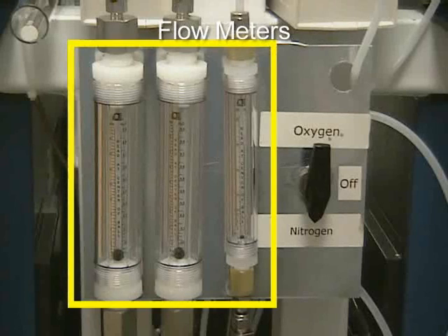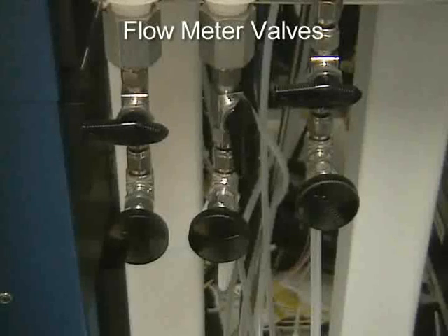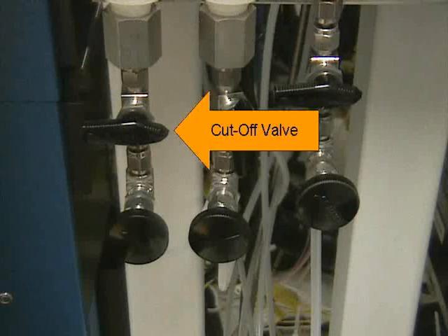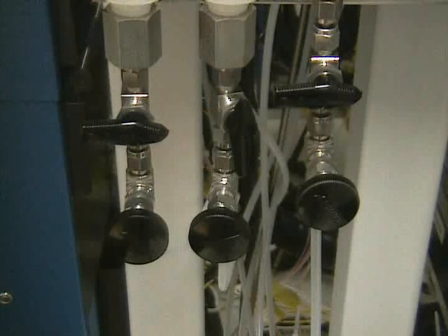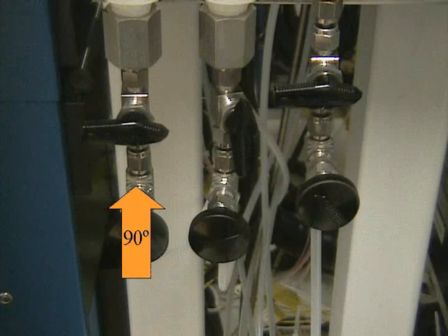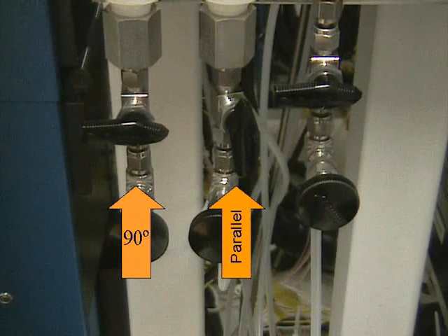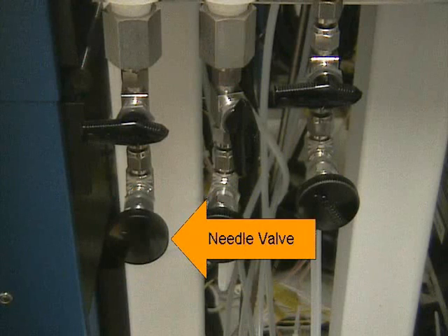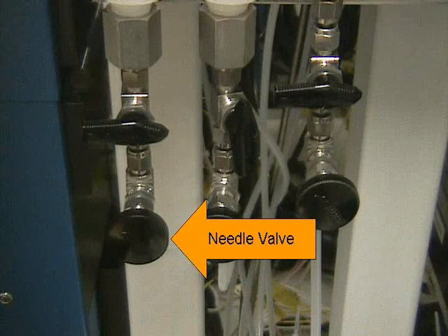There are three flow meters located just below the gas flow timers. Beneath each of the flow meters are two flow meter valves. The cutoff valves are closest to the flow meters — handles at a 90-degree angle from the flow meters are closed; when the handles are parallel with the flow meters, they are open. The lower valves are the needle valves, which control the gas flow into the flow meters.